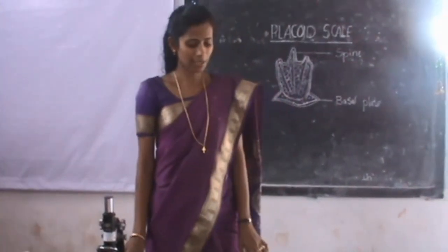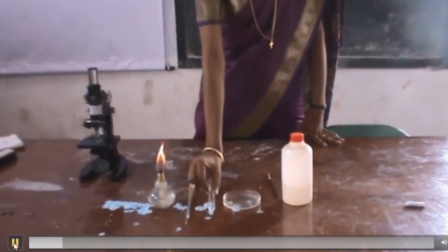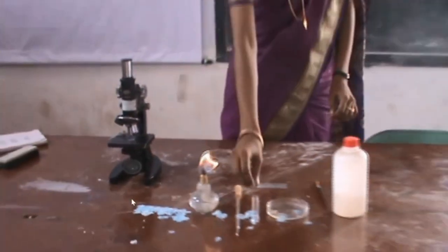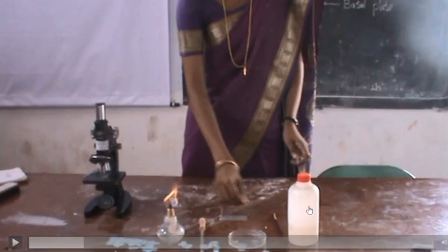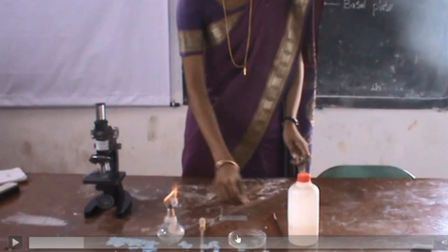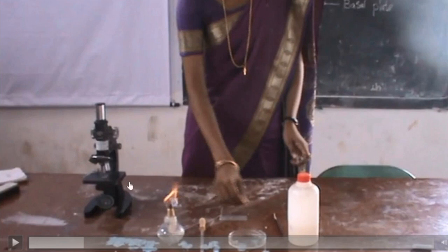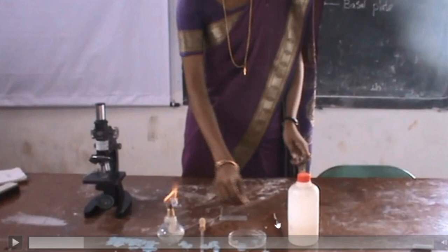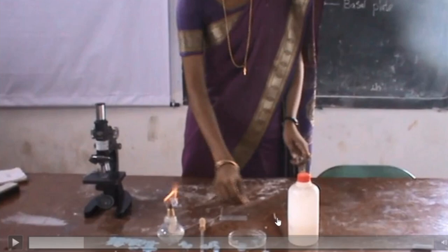Good morning everybody. Today we will see shark placoid scale. The materials required are: potassium hydroxide solution, shark skin, test tube, dropper, slide, spirit lamp, and a compound microscope. For the experiment we need 10% KOH solution, a spirit lamp, a dropper, a watch glass, a slide, a microscope, and also a brush to take out the scales - the type of brush commonly used in botany practicals.